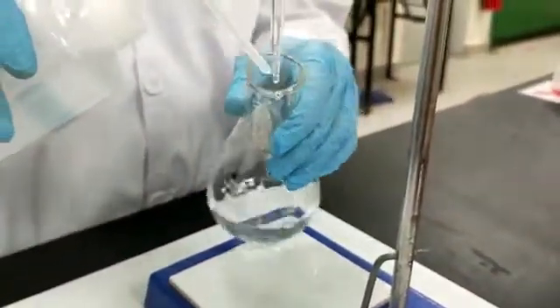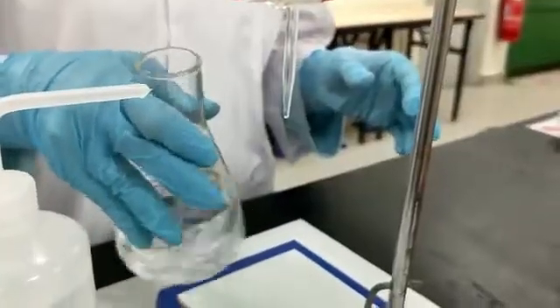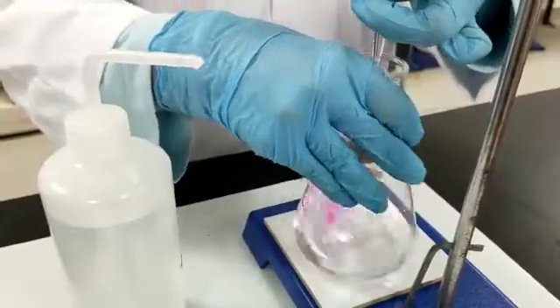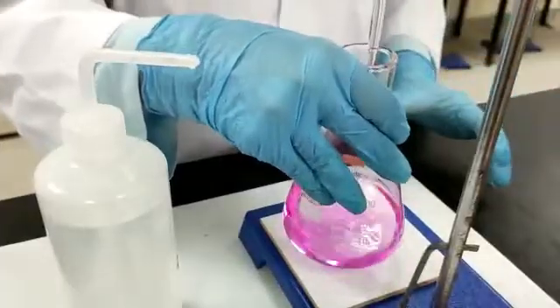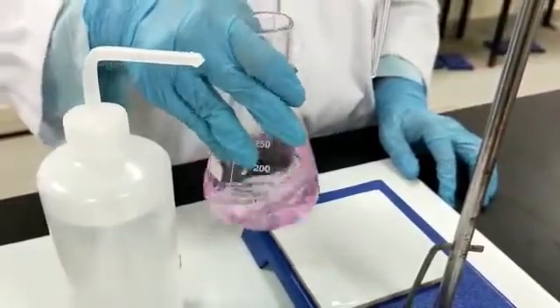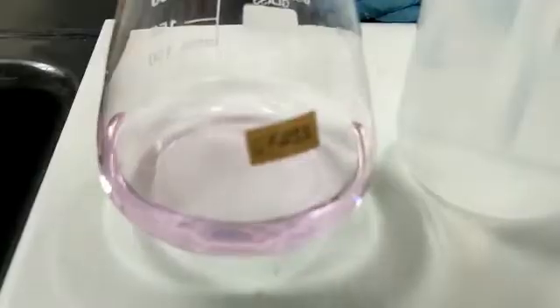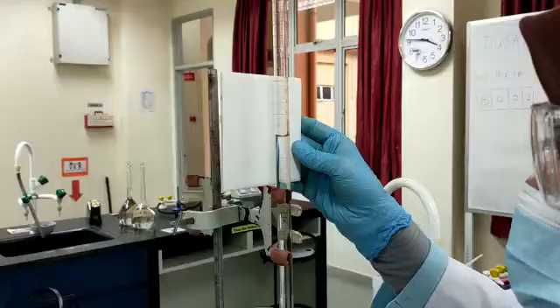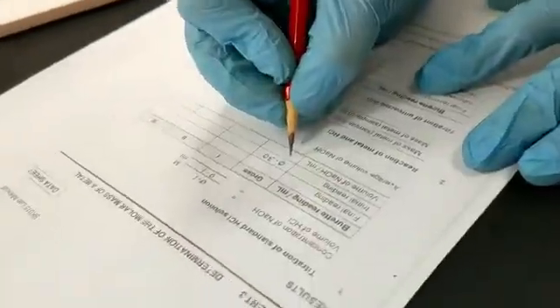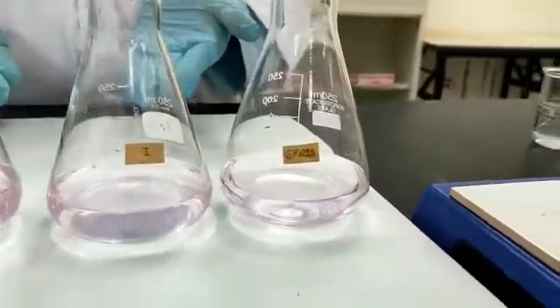At this point, rinse the internal wall of the conical flask with distilled water to wash down the unreacted solution. Upon reaching the endpoint, a temporary pink solution will appear, but the color will fade when it is swirled. Continue titration drop by drop until a pale pink color appears for more than 30 seconds. That is the endpoint for this titration. Use a white background to easily observe the bottom of the meniscus and record the final burette reading to 2 decimal places. Repeat the titration 3 times to get an accurate volume of titration.